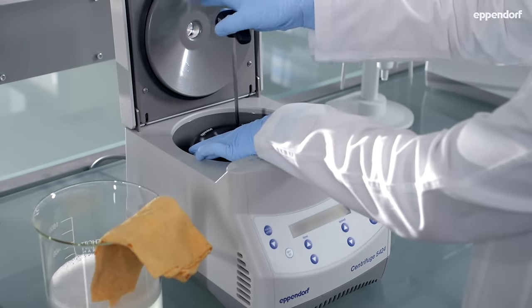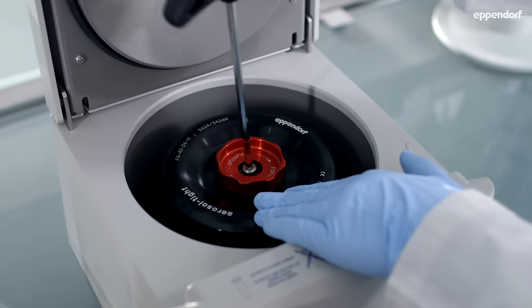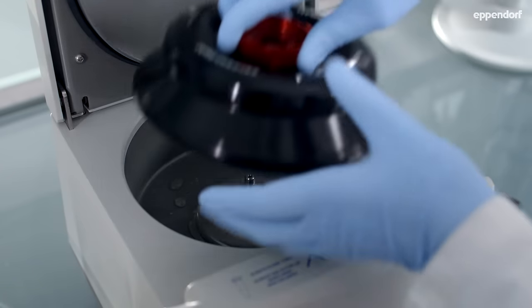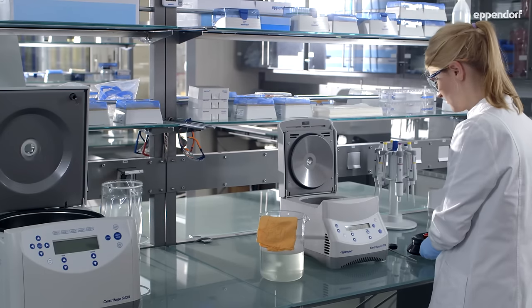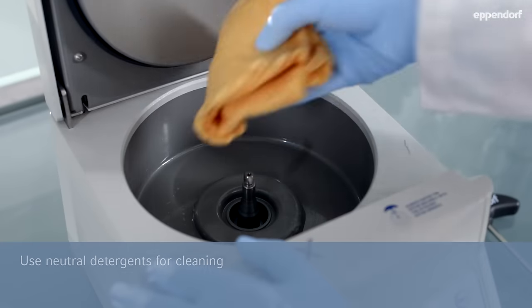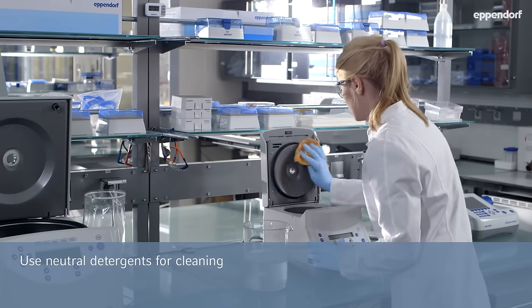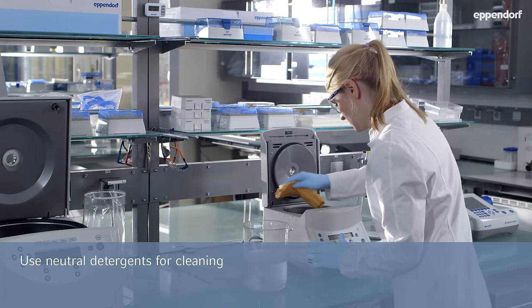To start with your maintenance program, please turn off the centrifuge first and remove the centrifuge rotor. Then clean centrifuge housing, rotor chamber and centrifuge equipment with neutral detergents.